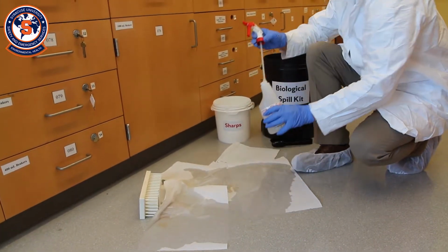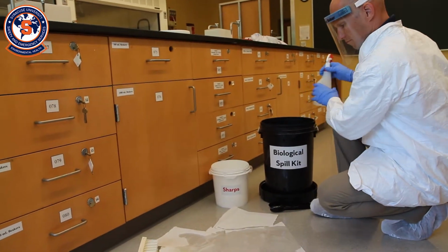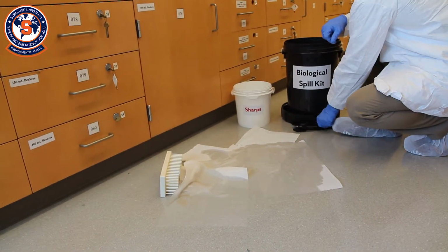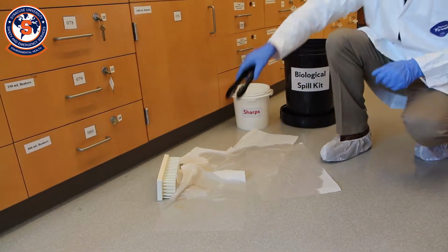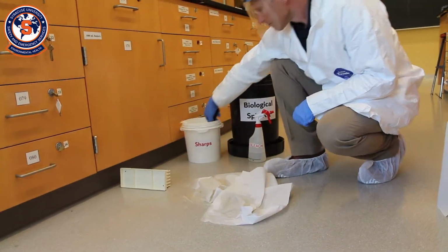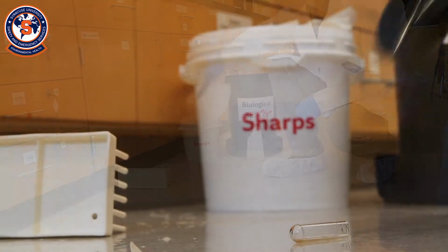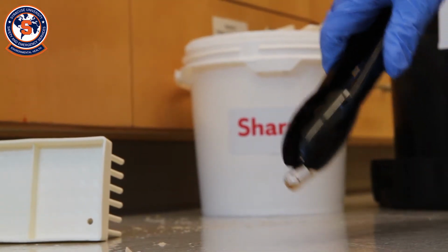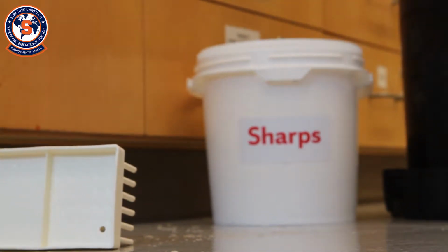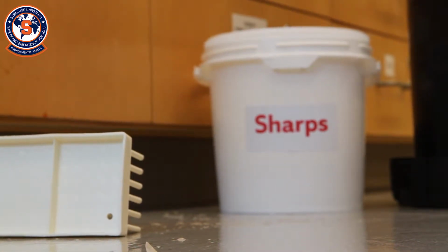Allow the disinfectant to remain in contact with the spilled material for at least 20 minutes. While waiting, soak some paper towels with disinfectants and wipe down all surfaces that may have been splashed by the spill. Never use your hands to clean up a spill that contains broken glass or other sharps. Use forceps to avoid injury from broken glass or other sharps. Dispose of cleanup materials and the broken glass into a sharps or puncture-proof container.